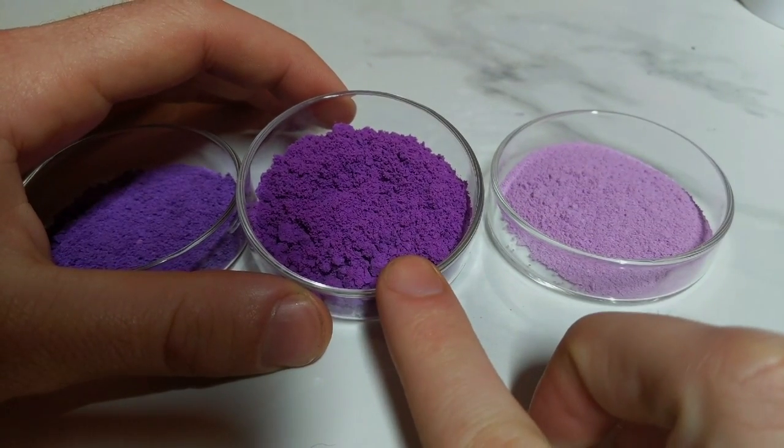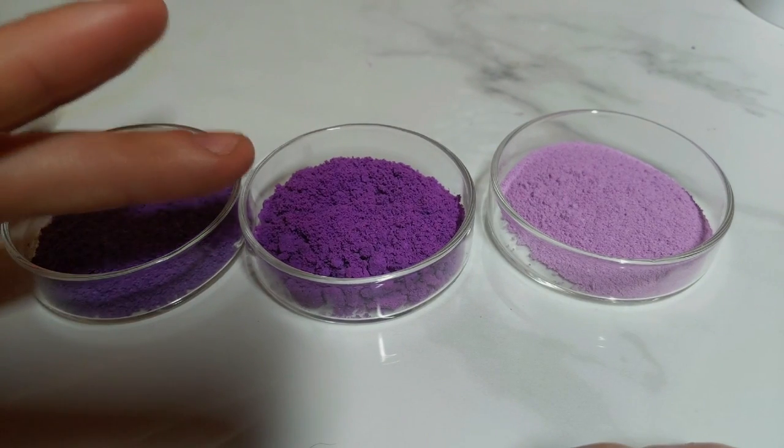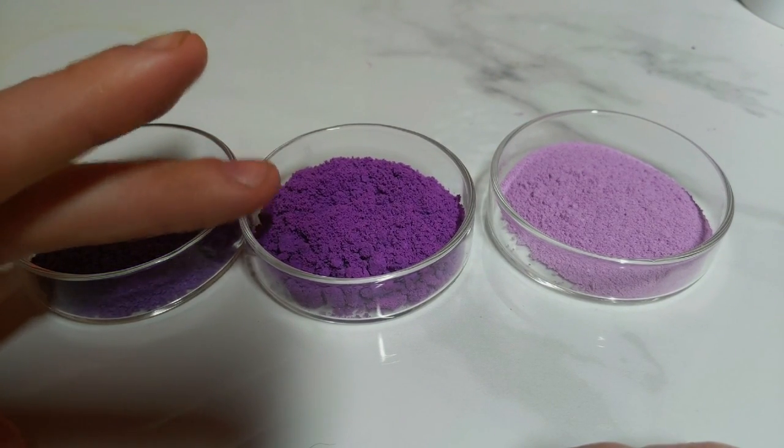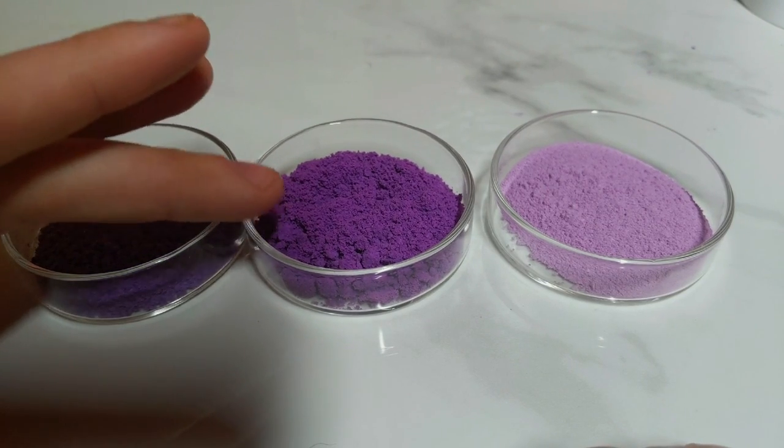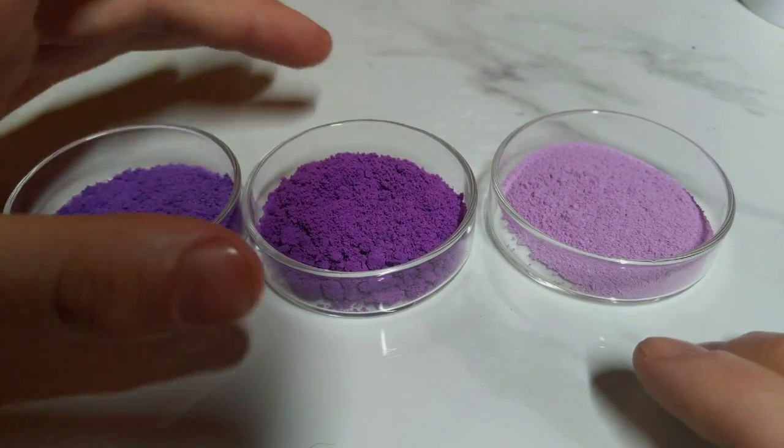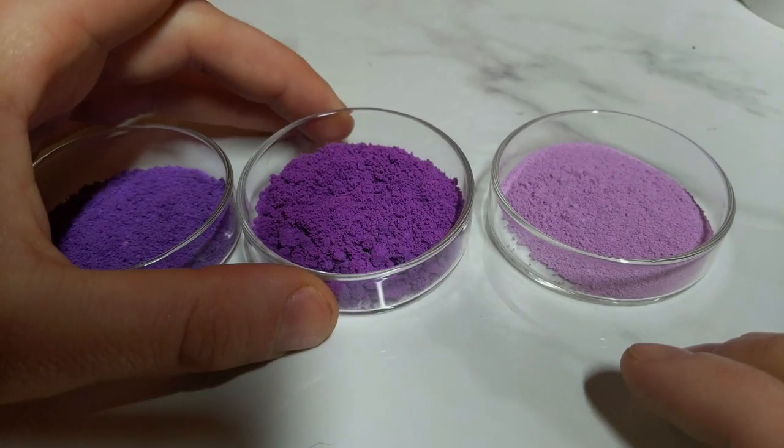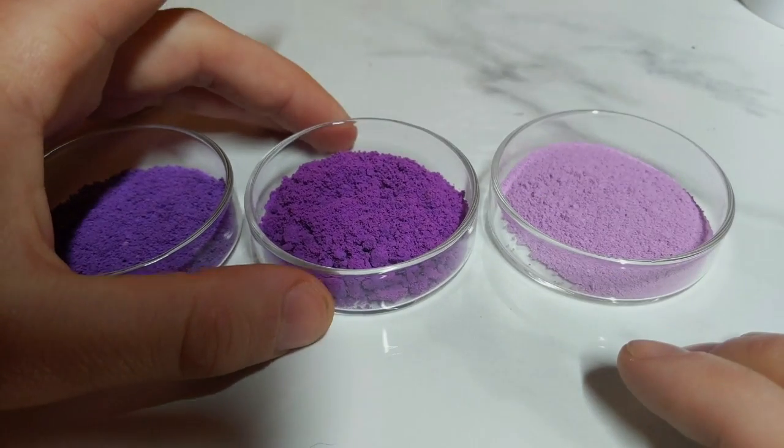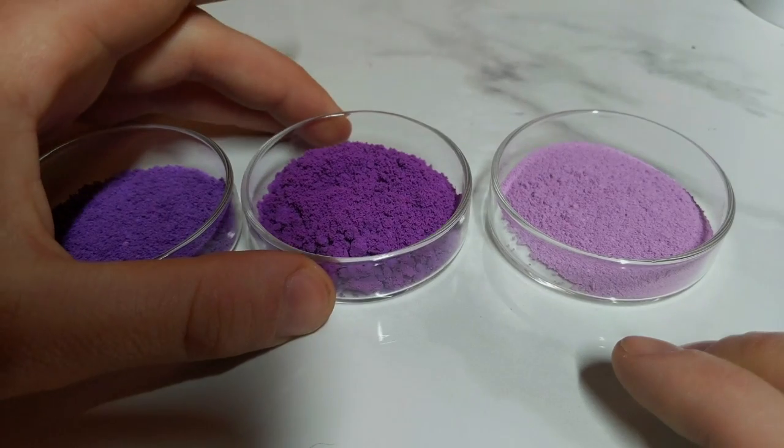But this was the one where I did the co-precipitation of the sodium hydroxide and the ammonia. And obviously we ended up with a darker shade than the first one, which was the intention. And I think this is by far my favourite of the purple that we got out of them. So yeah, I think this one was a particularly successful one.